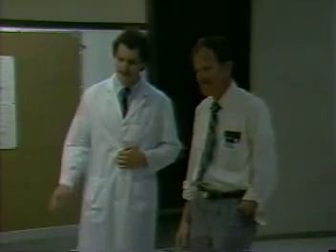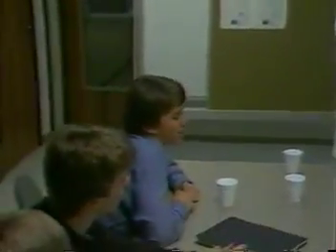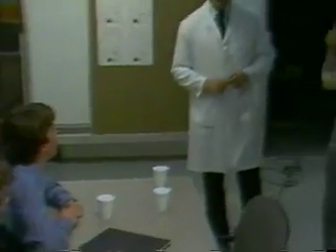So actually we'd like to go out and get this experiment performed by, oh hi Ken, how you doing? Good. This is Dr. Ken Ault. He's our Associate Scientific Director at Becton Dickinson. And this is actually Byron, and this is Christopher, and this is Brooke. Hi, nice to meet you. And they've actually been very good to come down here today, and we're hoping to look at their B-cell subpopulations. It may be quite interesting to see what we can find.